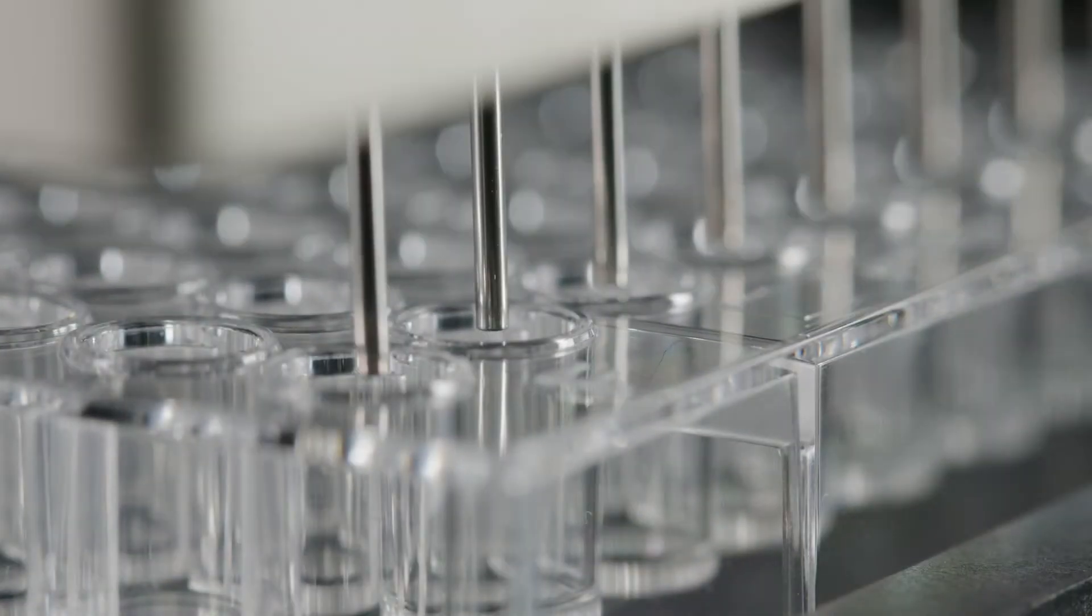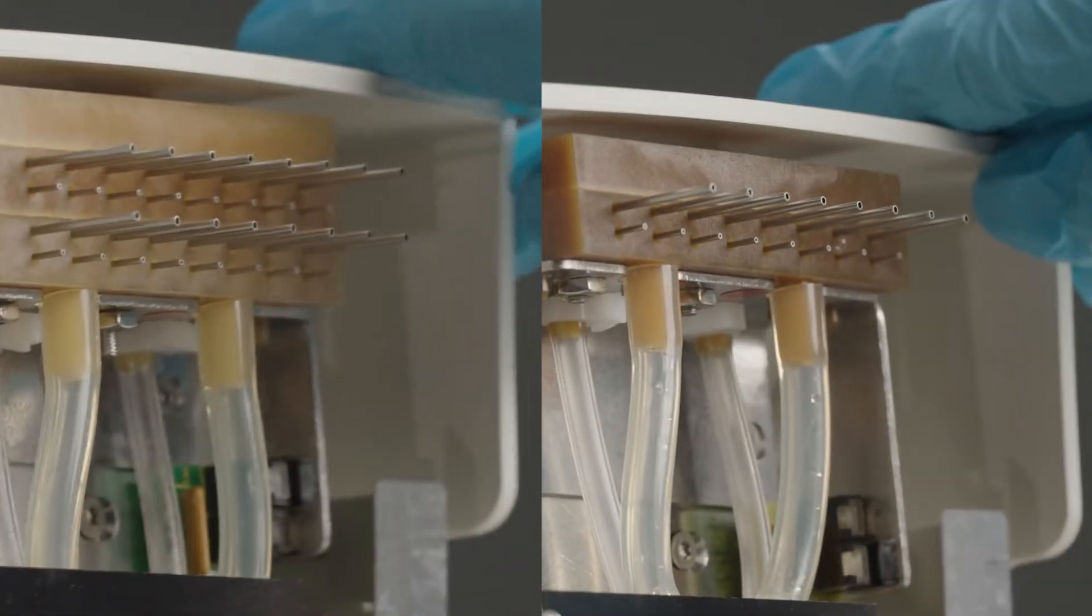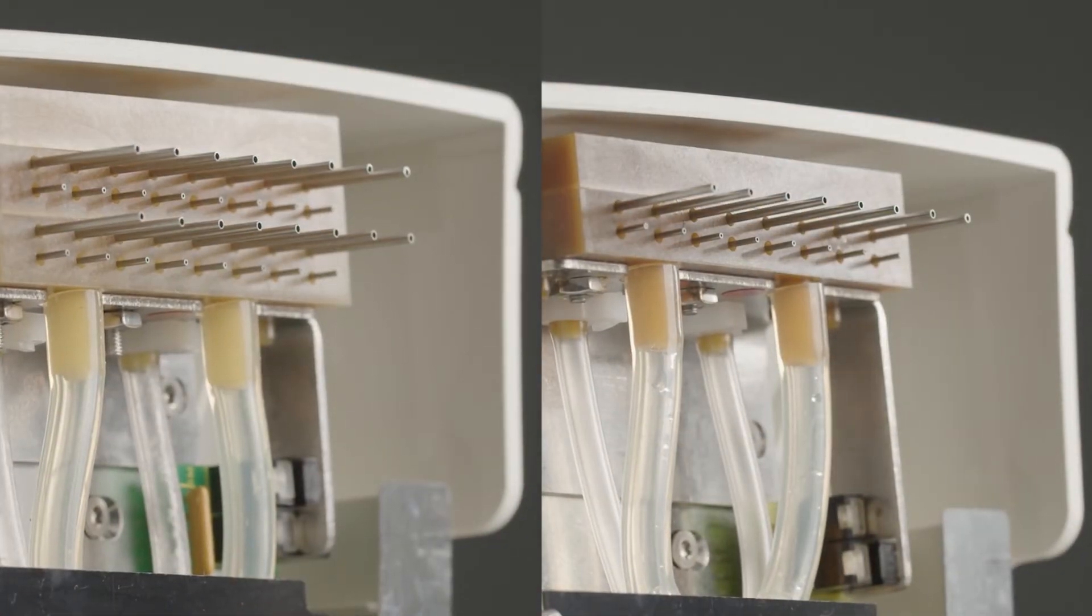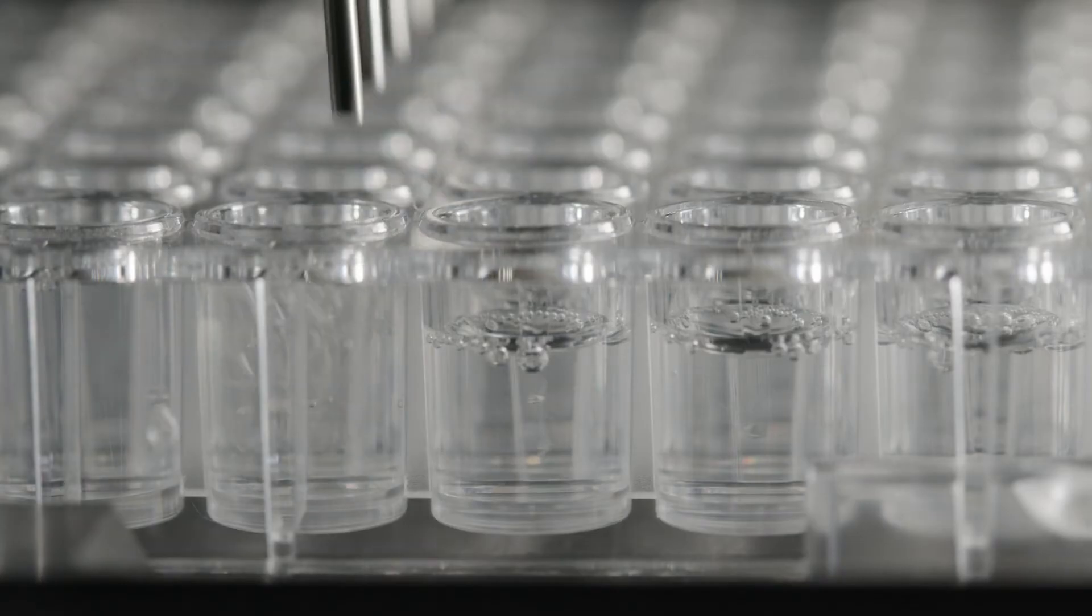The HydroFlex is a 96 well plate strip washer available with an 8 or 16 channel manifold which is ideal for cell washing and ELISAs.